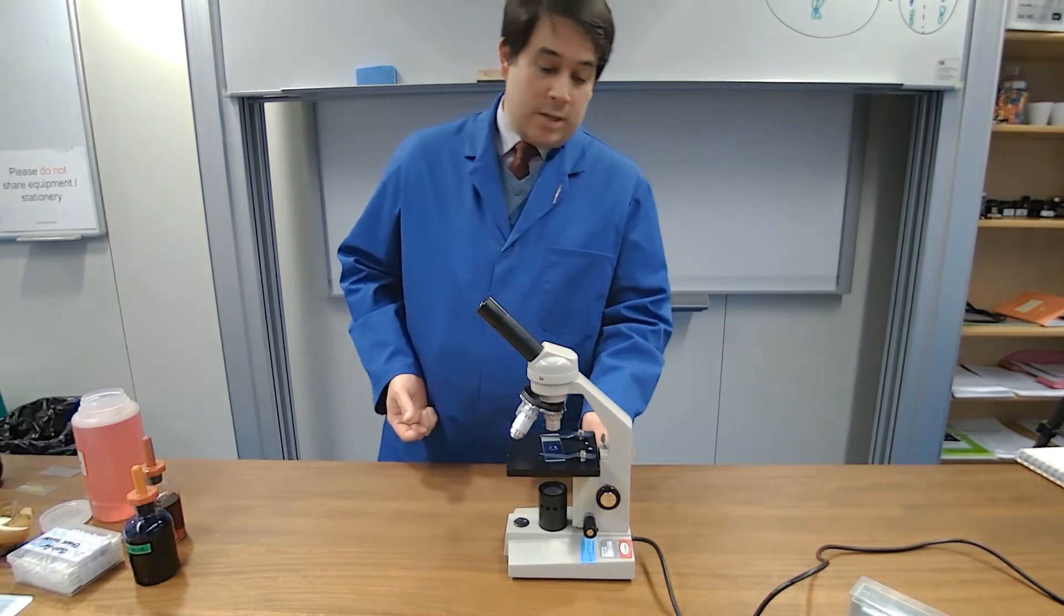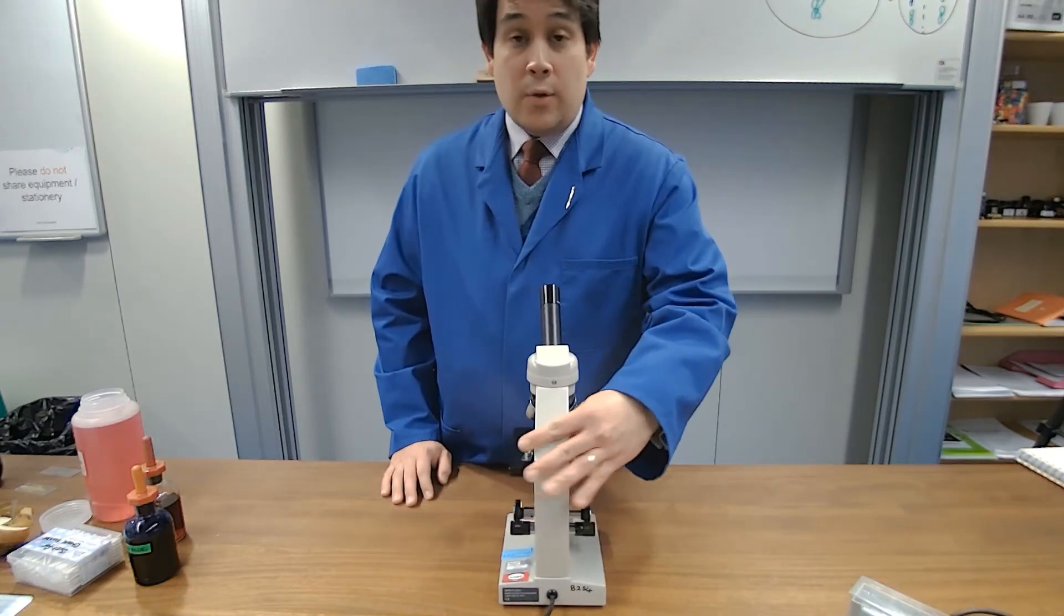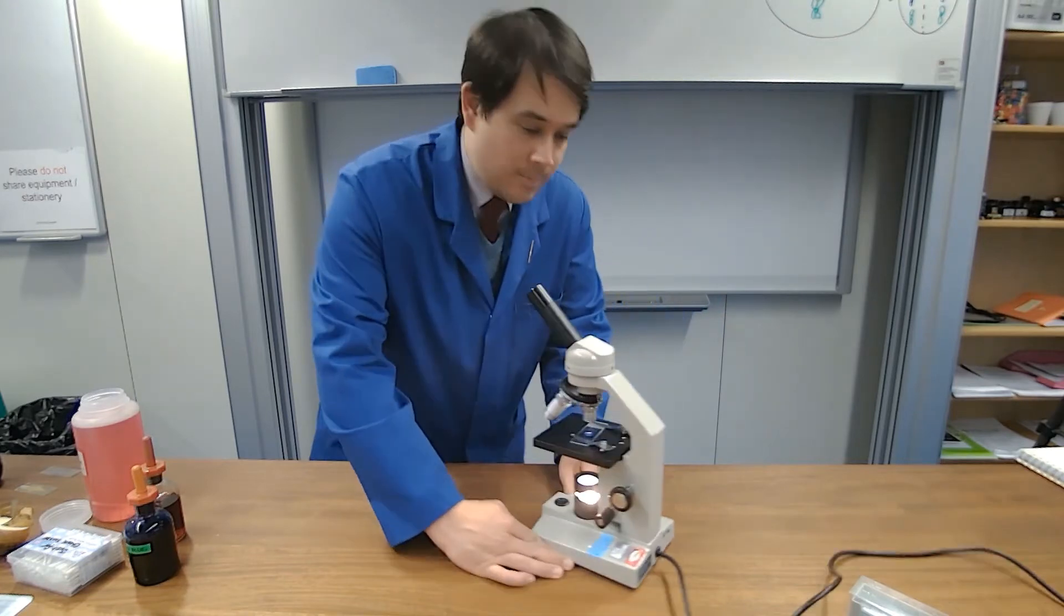We then raise the stage to its highest possible point and then we look at it, turn it on, look through it and try to find the image as best as possible. How do we do that?